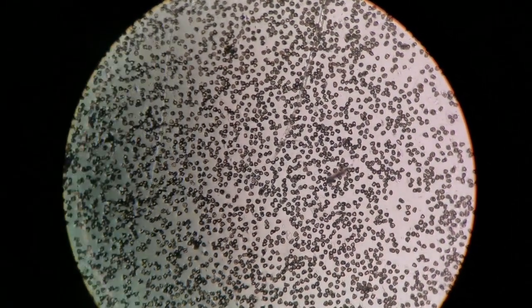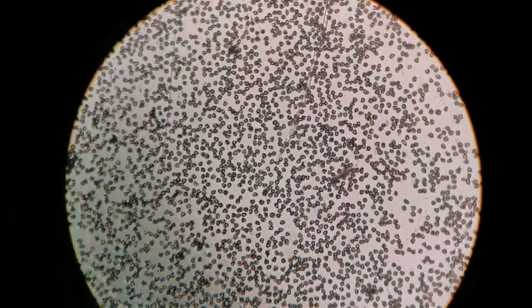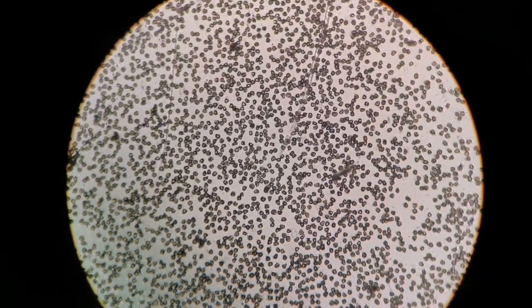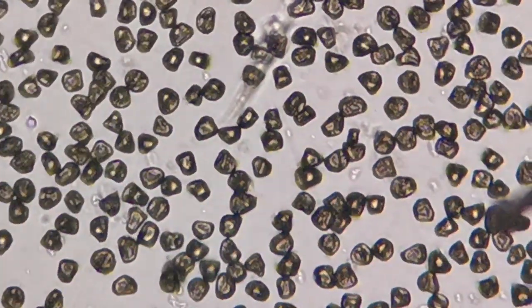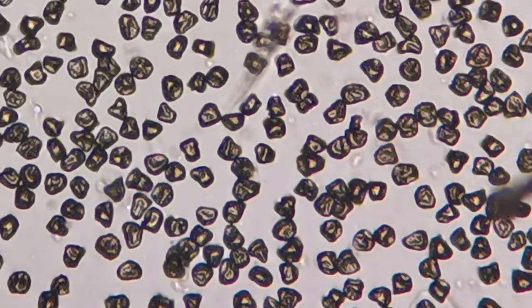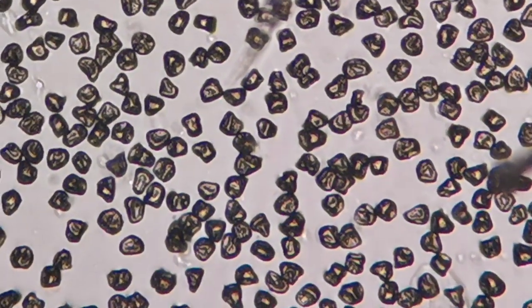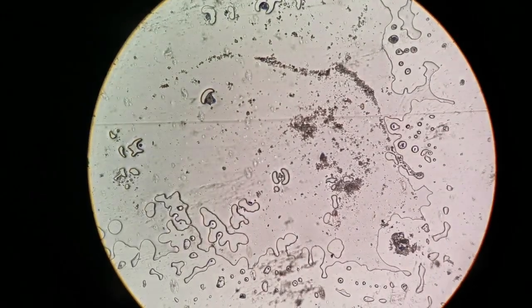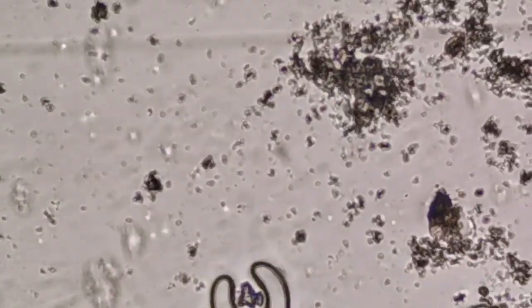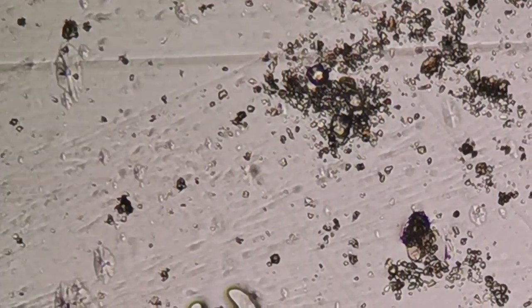So this is the yew tree pollen. As you can see, there are many shapes, but mostly triangular and a little bit punctured. And this is the Sahara dust. It's much finer. Sahara dust is this material which has a kind of darkish material, darkish edges.